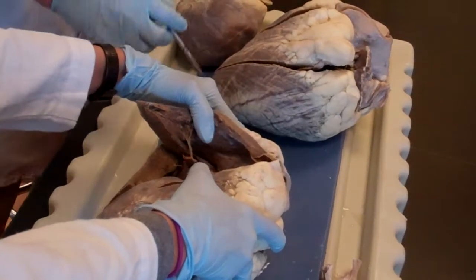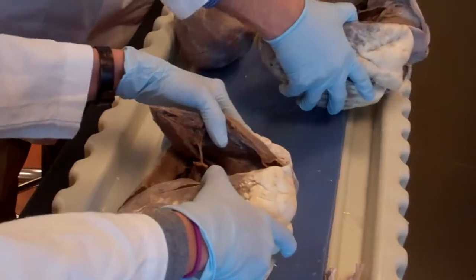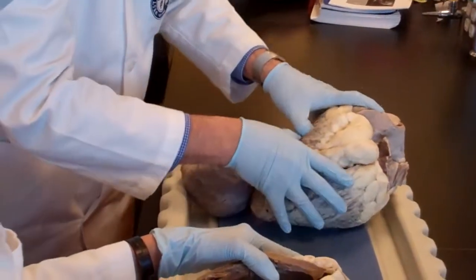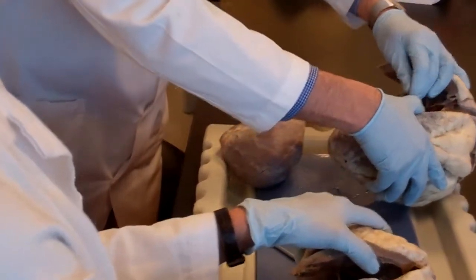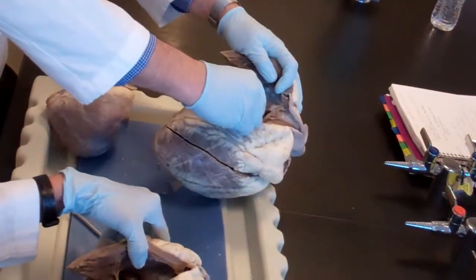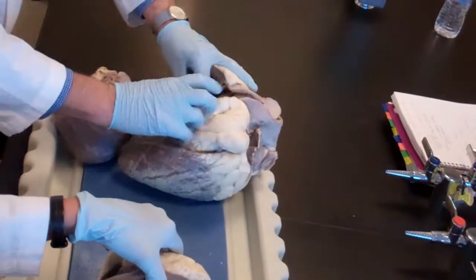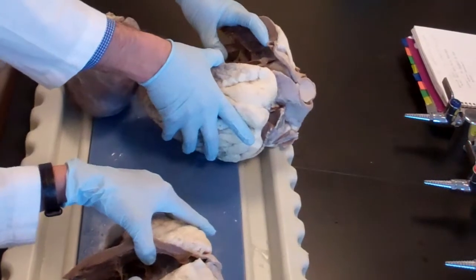You didn't see anything. Come on. Come. Don't be shy. Yes, and here is the other one. Okay, if I'm oriented properly, I have to orient myself first. Yes, this is the right side. Okay, and this is the leftover of the moderator band after it was messed up by the previous students from the former term.